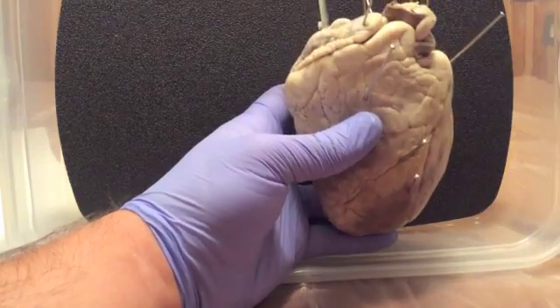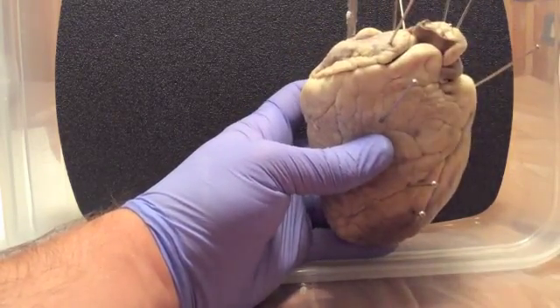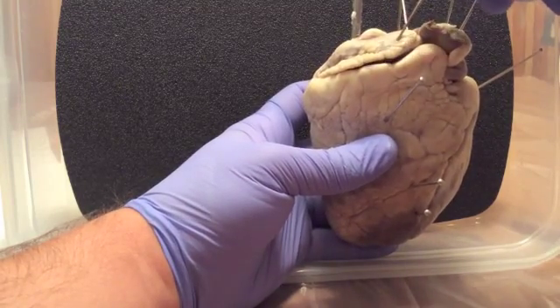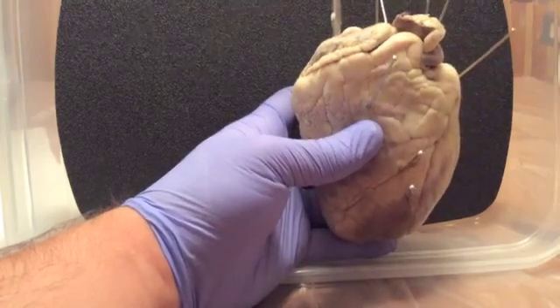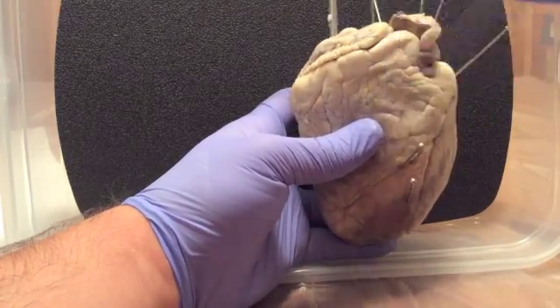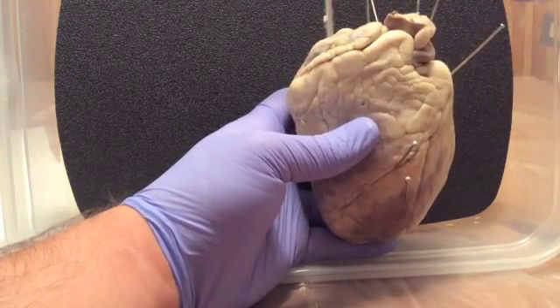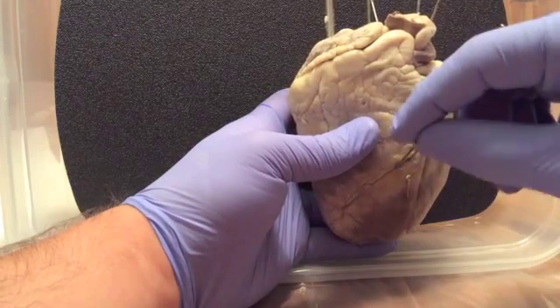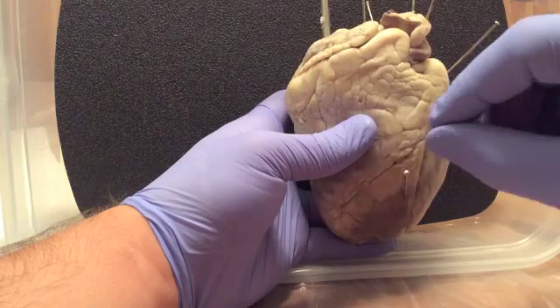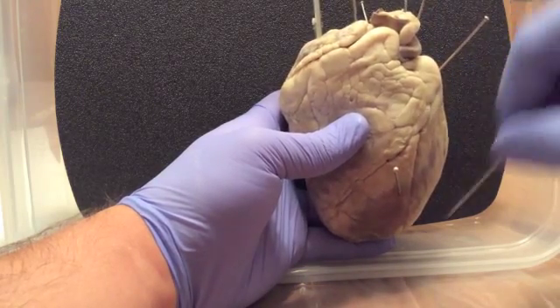bottom. Back here we have the vena cava, which goes into the right atria, and then we got the right auricle, which is the muscular portion of the atria, and we got the right ventricle, which leads to the lungs, this is the low pressure side of the heart here. Then here we have the interventricular sulcus. It's going to be the division between both ventricles, the right and the left.